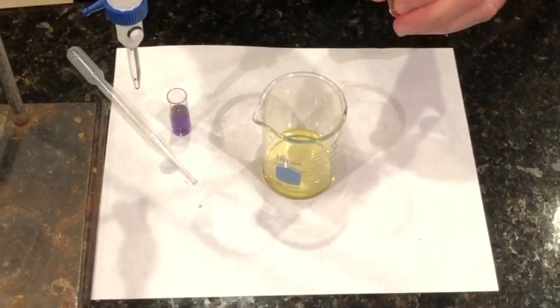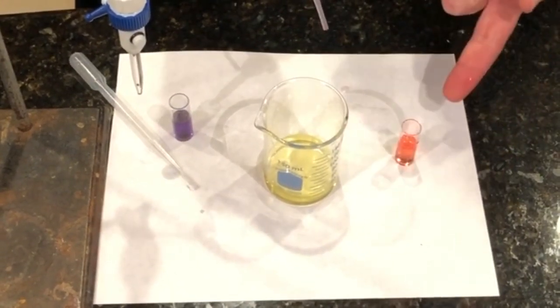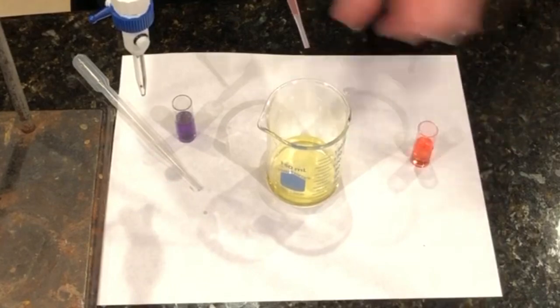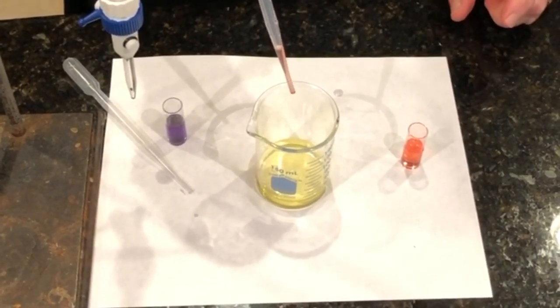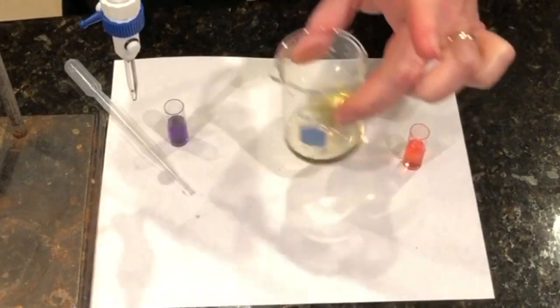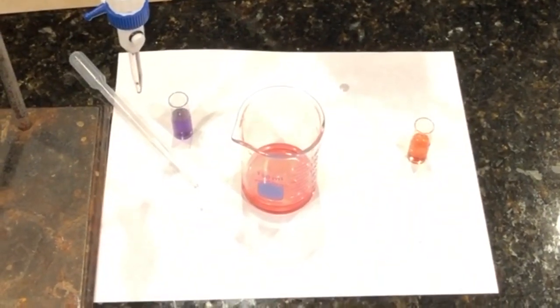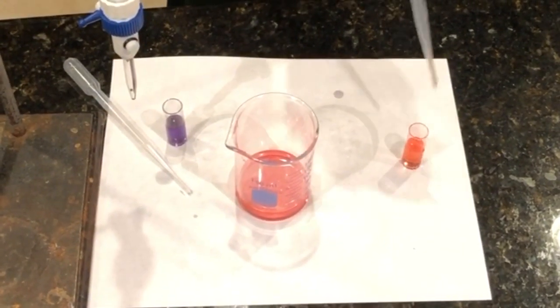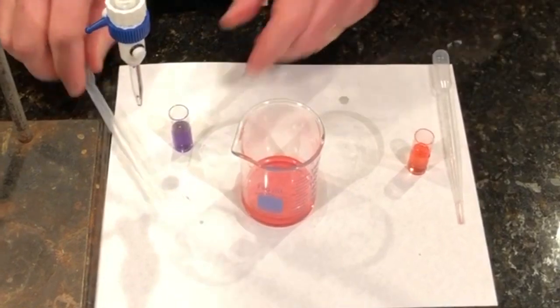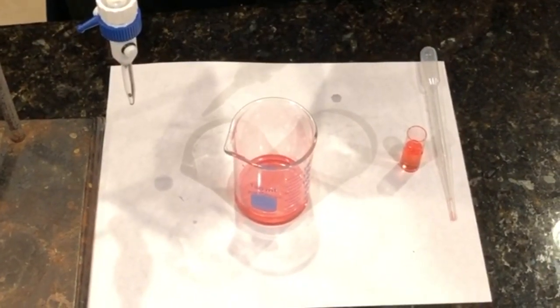So it really takes very little acid to turn it. This is strong acid, strong base. This is HCl. That's sodium hydroxide. So as you can see, I can just add like a drop of acid to water, and it turns into a pH 1. So with a strong acid, water won't fight to maintain its pH, and it won't fight in the presence of strong base to maintain its pH.